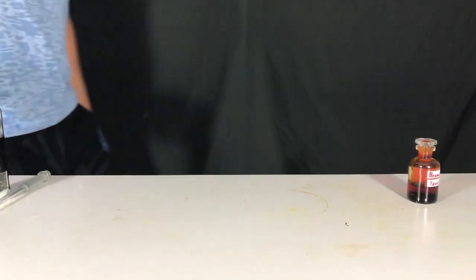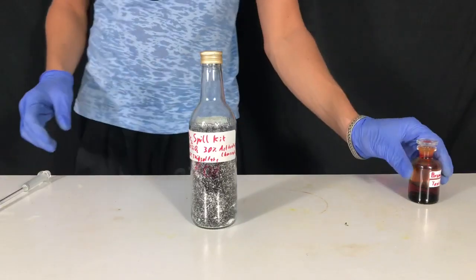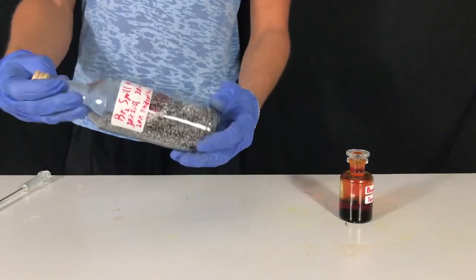Welcome back everyone. Today I am going to demonstrate to you how I deal with bromine spills. For this I'm going to use some elemental bromine and the bromine spill kit.